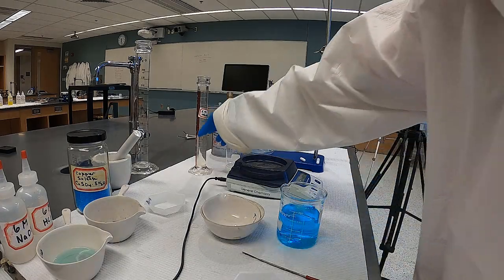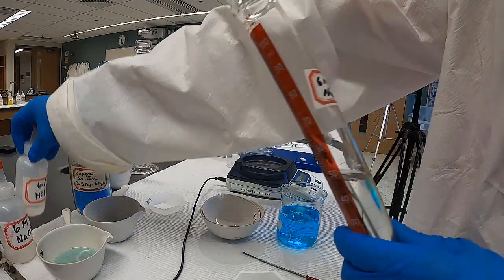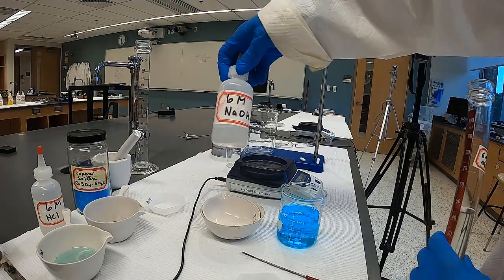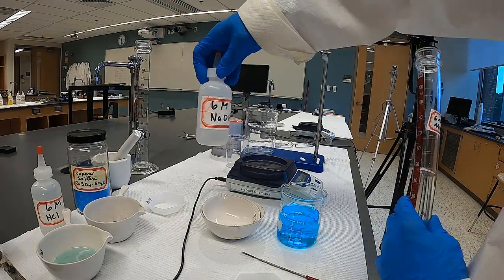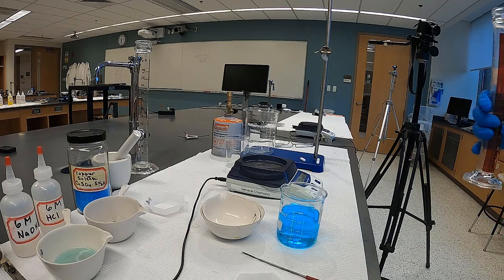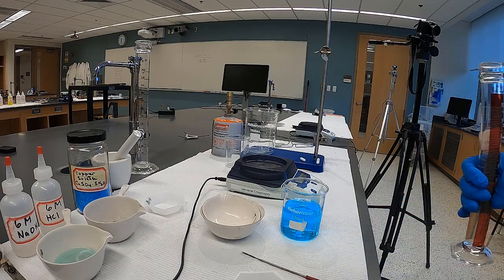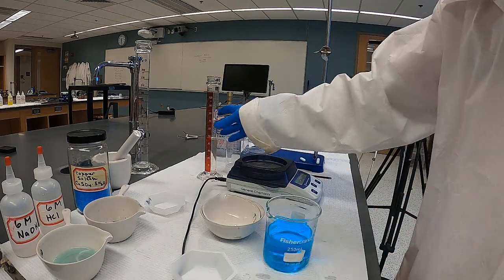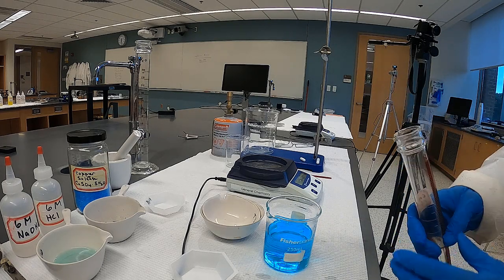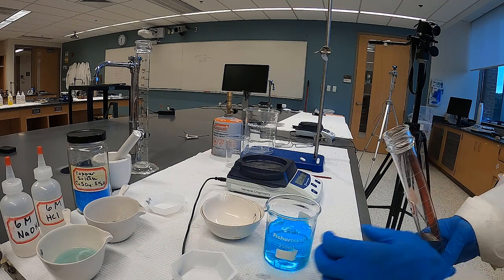So the next step would be to take 6 molar sodium hydroxide, which I have right here, and I dispensed it from the, oh, that's hydrochloric acid, sorry, just the opposite. Here's sodium hydroxide, 6 molar, that's pretty concentrated. And I'm going to go ahead and add the prescribed amount of that to this once it's all in solution. And I'm going to add the strong base to the copper sulfate.